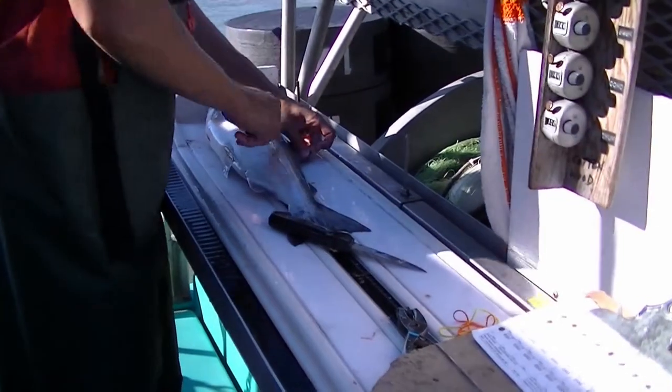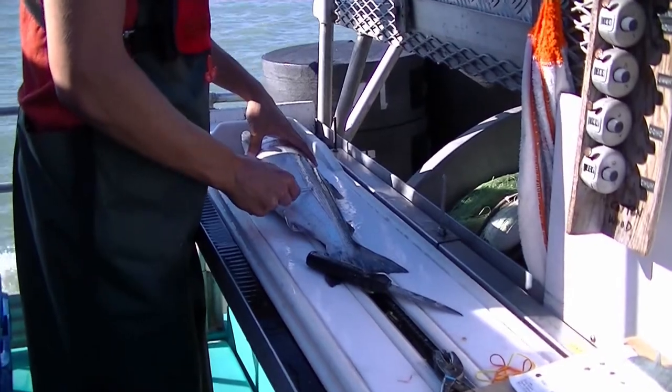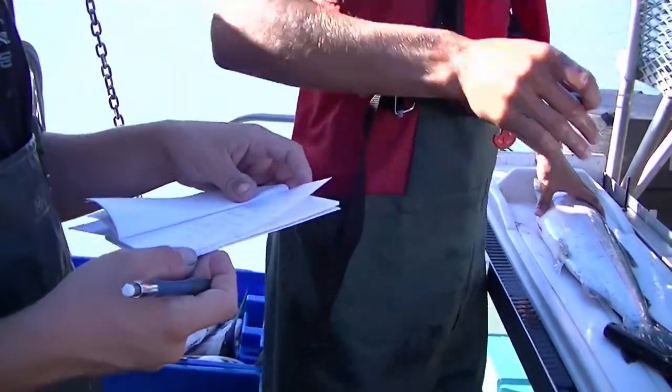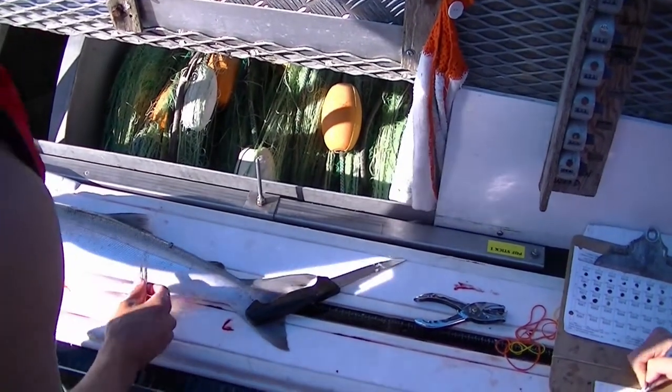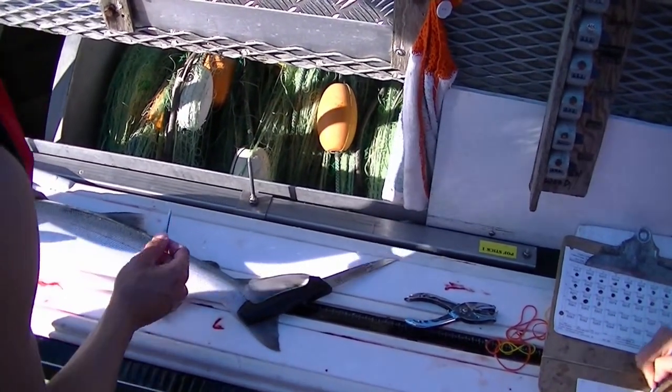The scale should be carefully placed in the folded pocket of the scalebook next to the corresponding biological data. Make sure the single scale has been deposited and be careful not to use excessive force when handling the scale, otherwise it may become damaged and become impossible to analyze.